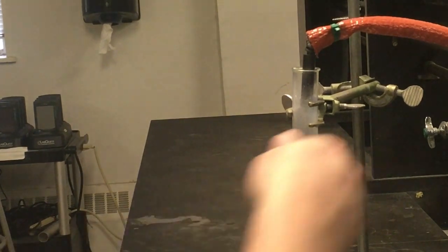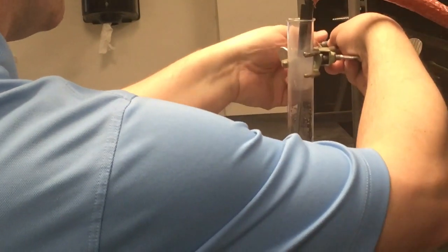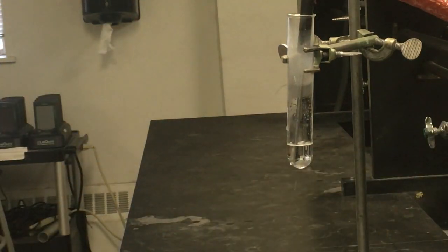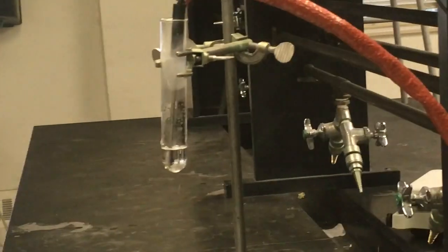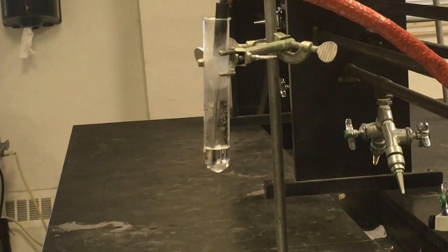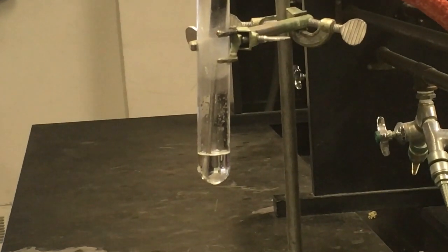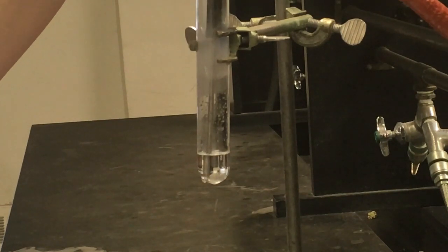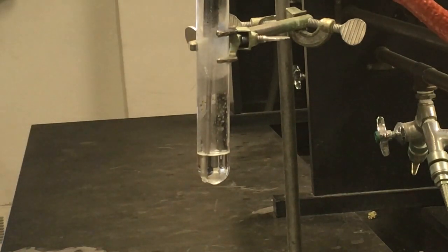I'm going to lift this up maybe just a touch higher so we can zoom in on this better. Apologize for not having an easy expert camera setup here. So now if we take a look at our solution, we're just going to wait and see when we first get crystals to form, as well as when this thing is going to be fully solidified. And notice it should take a little bit longer for this to happen this time. I'm going to mix this just a little bit, make sure everything's good there.